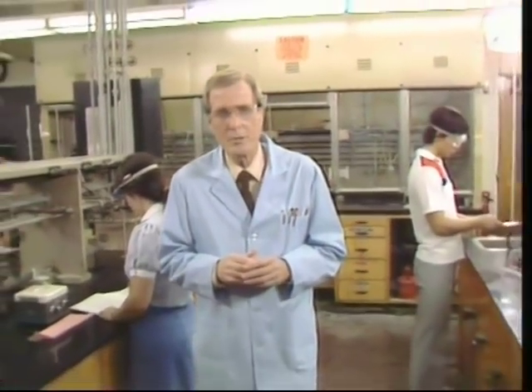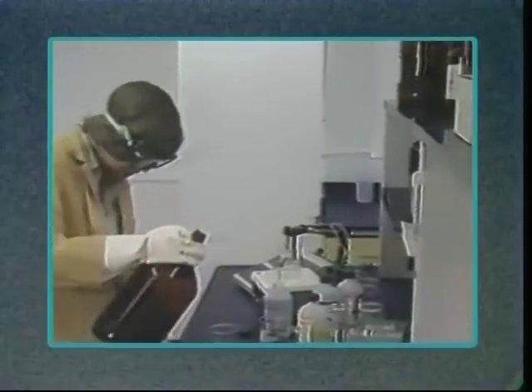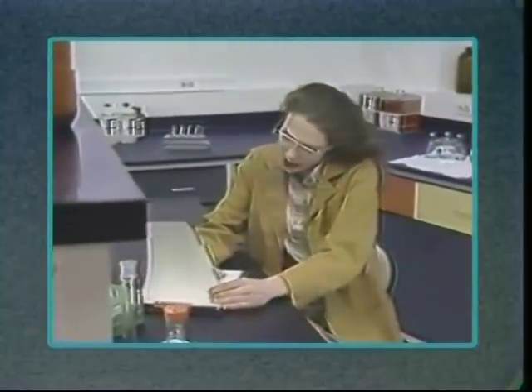Let's take a look at an example. Many accidents cause injury to people who just happen to be near the accident. In this case here, the woman on the left is working on an experiment while her friend is taking notes. You can see just how quickly an accident can occur.